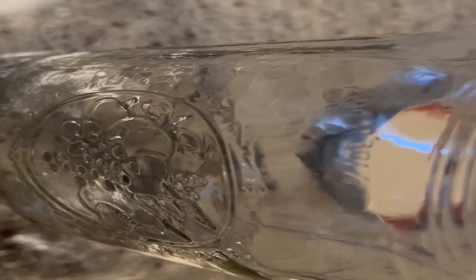Once your agar is mixed up and ready, pour it into the jars. I like using hot water so everything dissolves. I pour about 50 milliliters of agar mix per jar — I eyeball it using the little notches on the side of the mason jar. If these were agar plates I wouldn't pour that much, but because we're making master slurry cultures I want a little more agar than normal, so about 50 milliliters. Once all your jars are filled, put the lids and jar rings on.